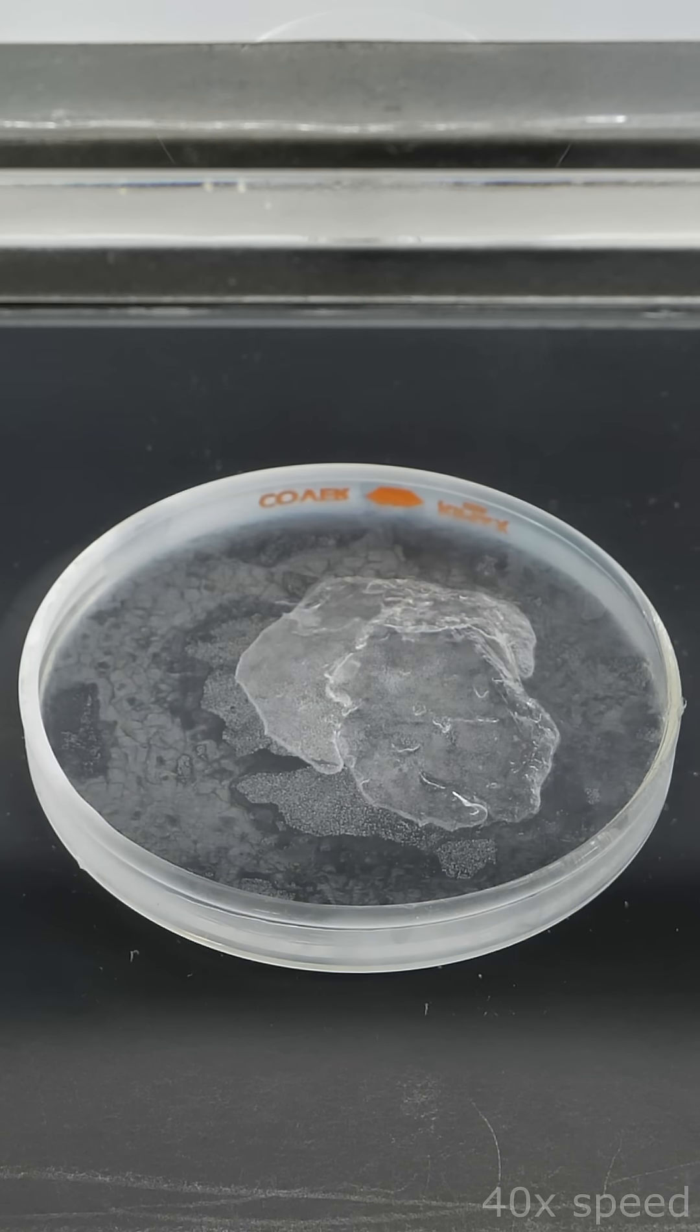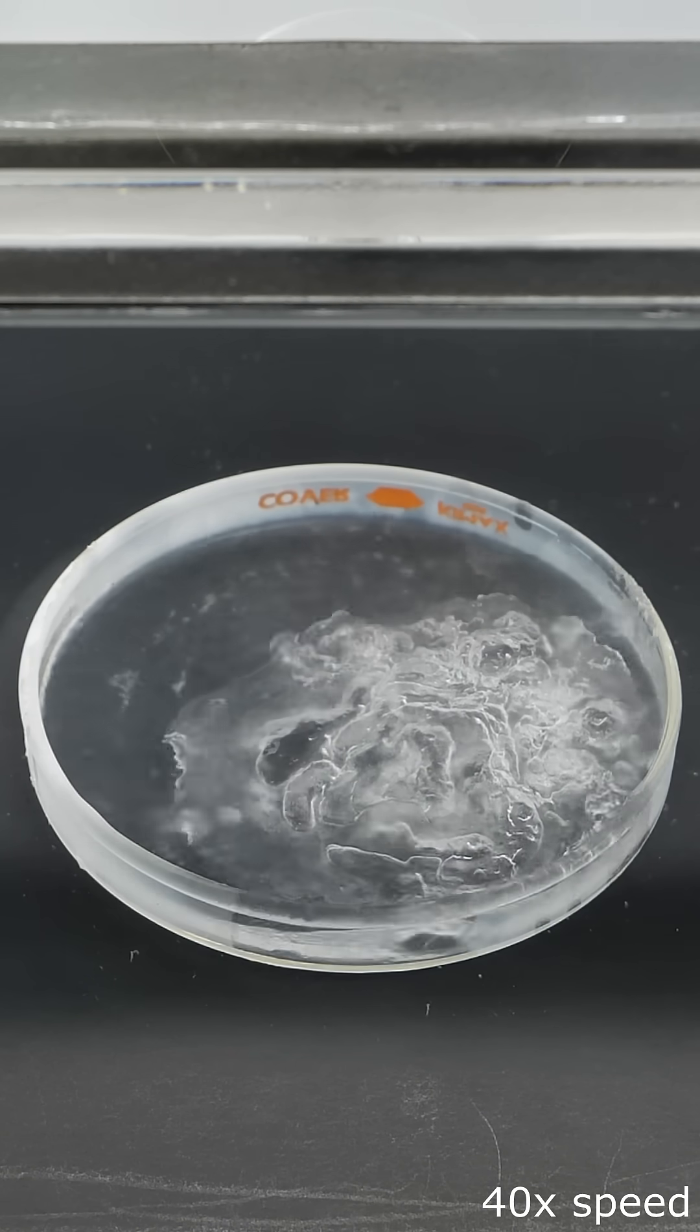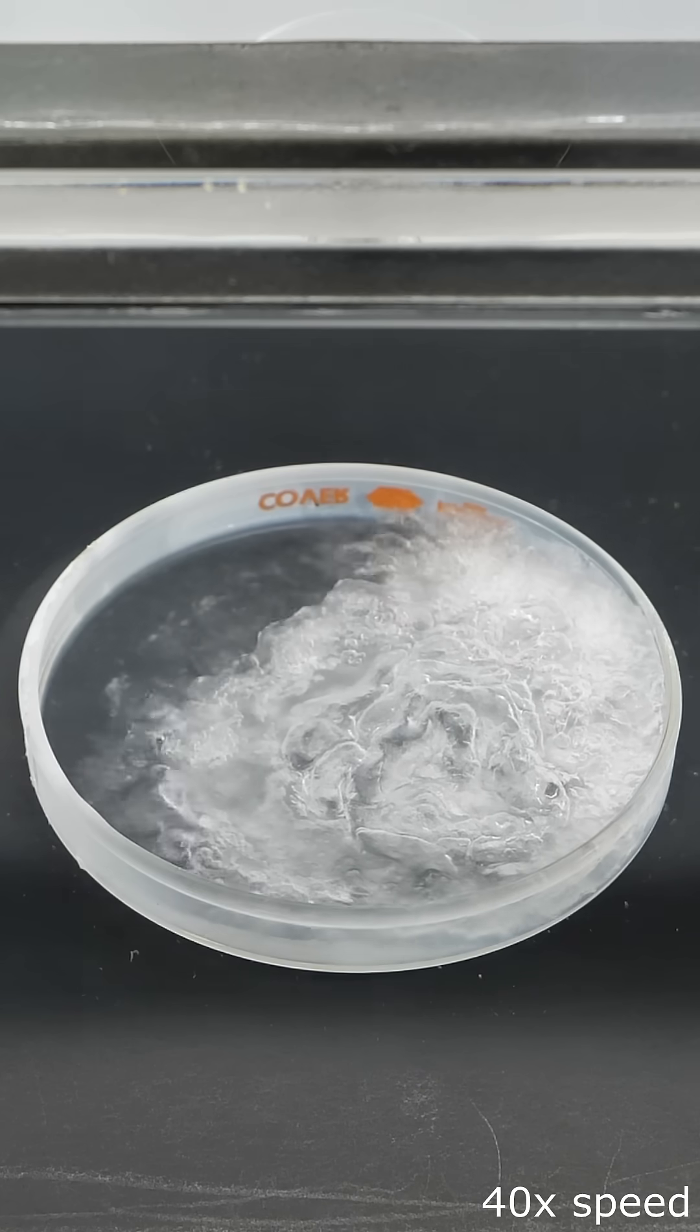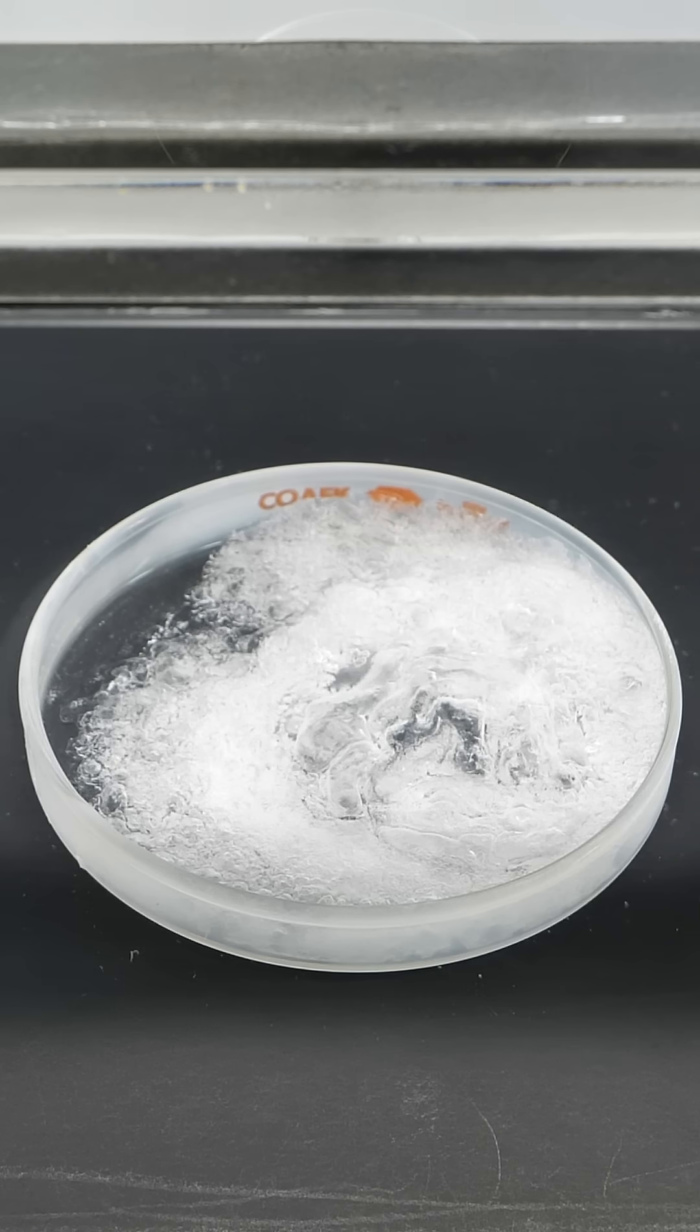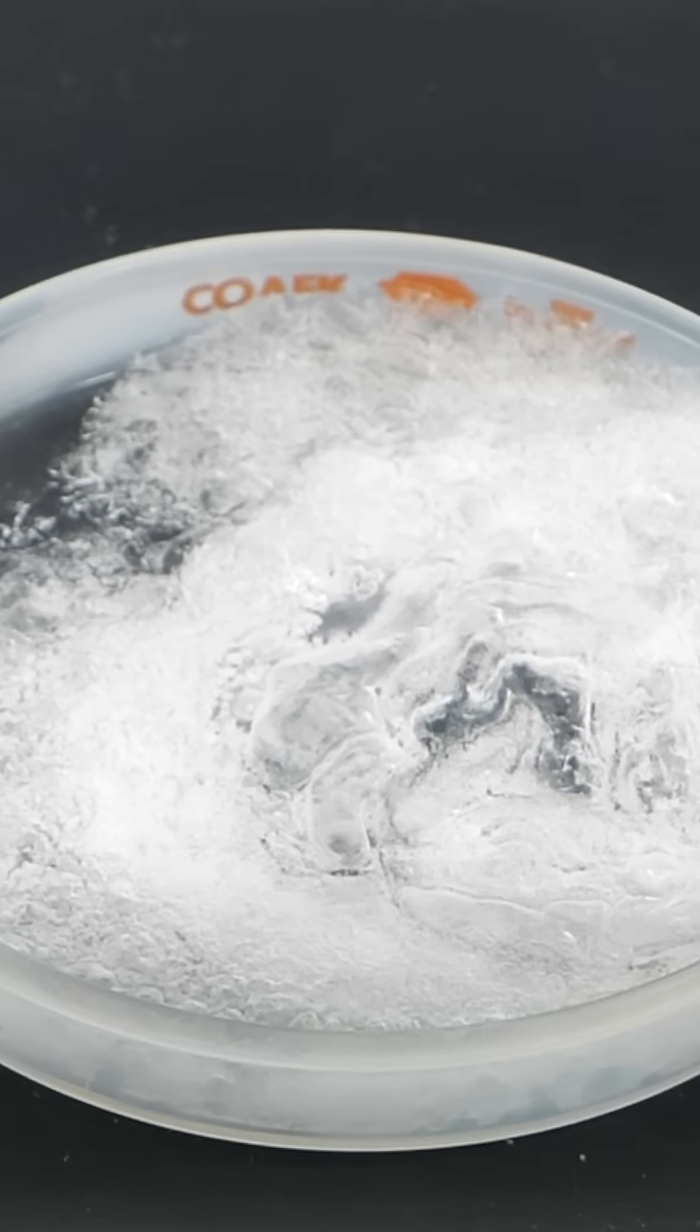I decided to just leave the pump on, though, and to see what would happen. To my surprise, it actually stopped cycling, and over the next few minutes, the entire thing solidified. What I had now was completely solid nitrogen.